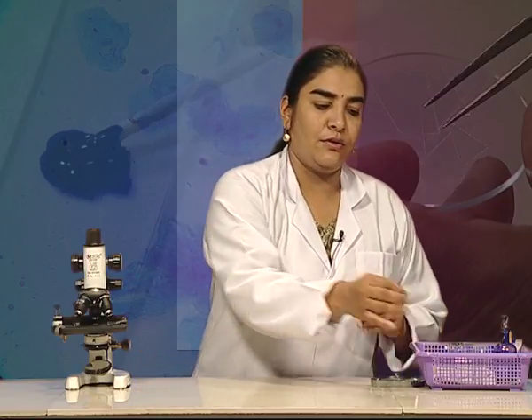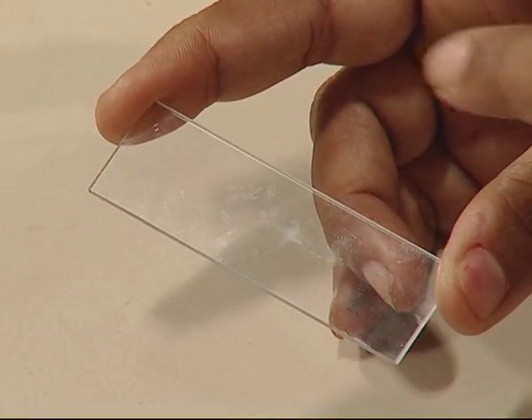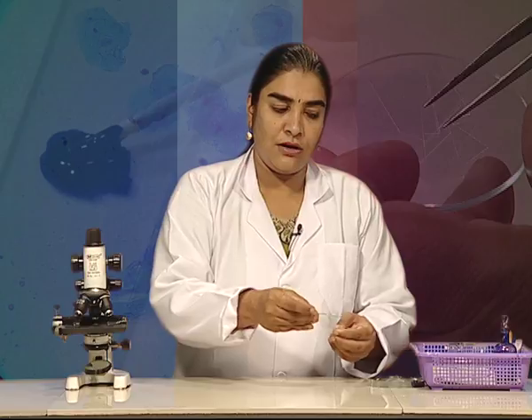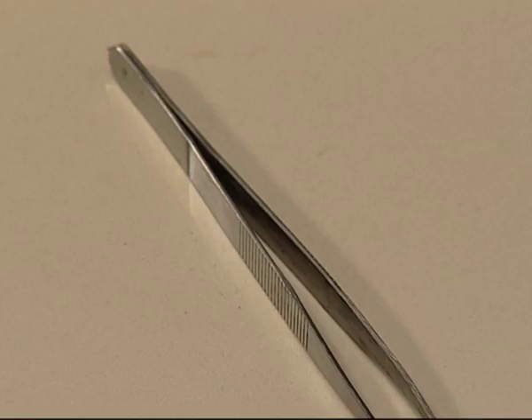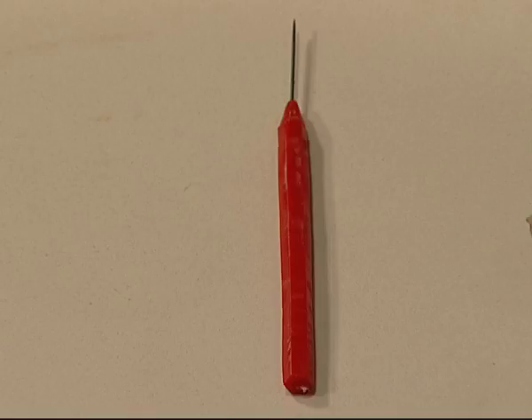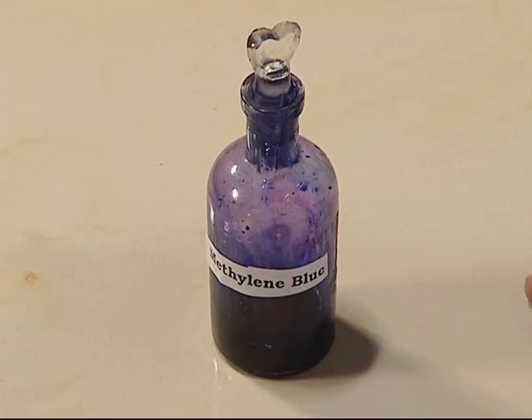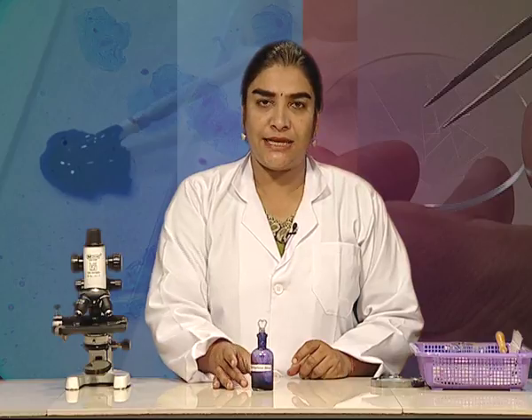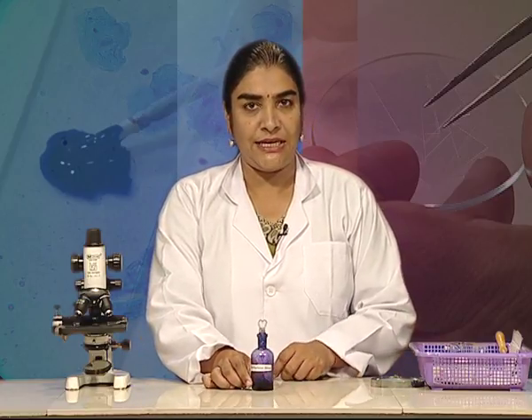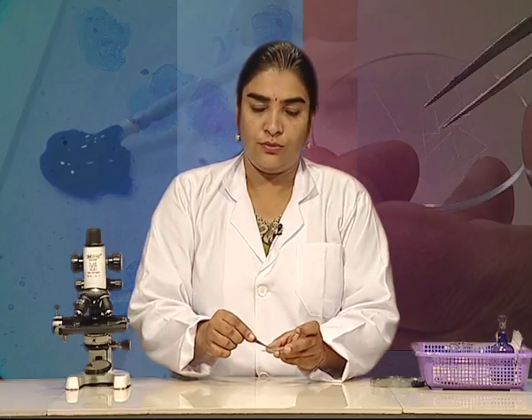Let us see what all we need for making this temporary mount. We need a slide — the slide should be clean and make sure that you hold it only by its edges so that it does not get dirty. A dropper, filter paper, toothpick, a forcep, dissecting needle, water in a beaker, and a stain to color the cheek epithelial cells. Here, we use the stain methylene blue because methylene blue can easily stain the outer covering or the cell membrane of the cheek epithelial cells, and a cover slip.